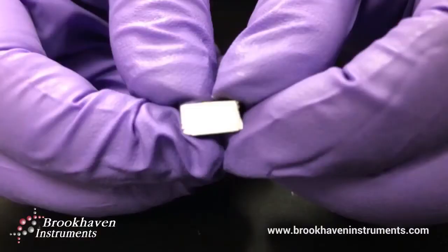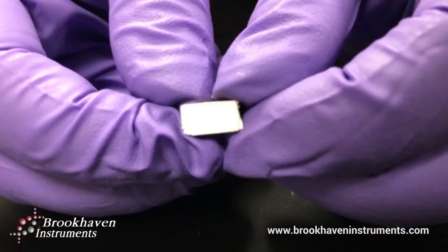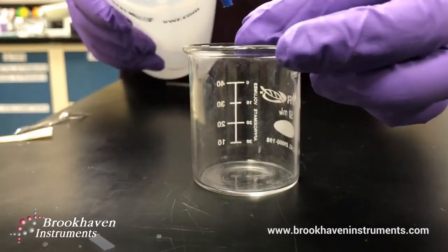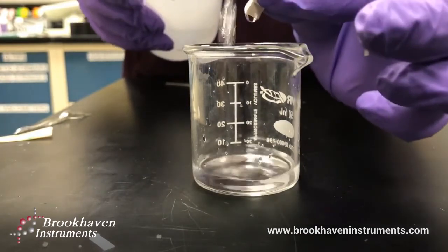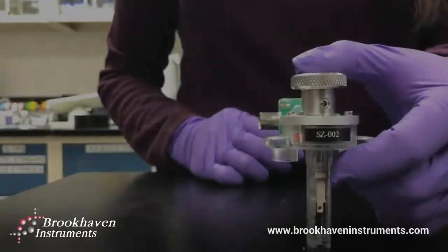Now you can proceed with cutting it to size. Try to make sure all edges are clean. This leaves you with a perfectly sized piece of your sample. And now, to rid the sample of any dust or impurities, rinse with deionized water prior to measurement.